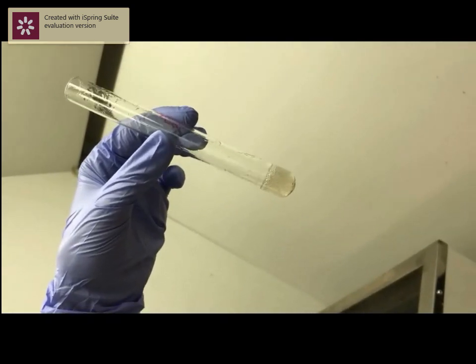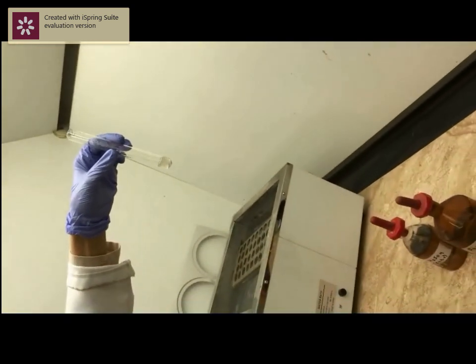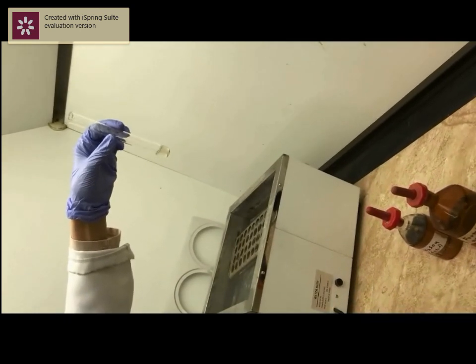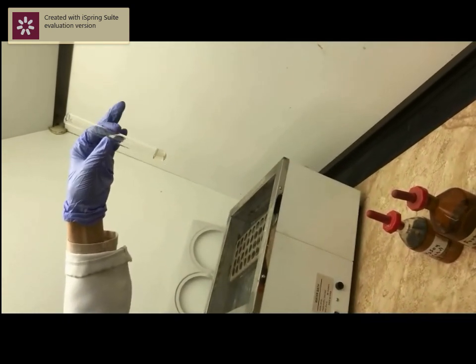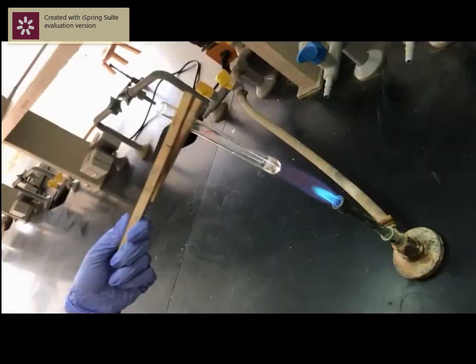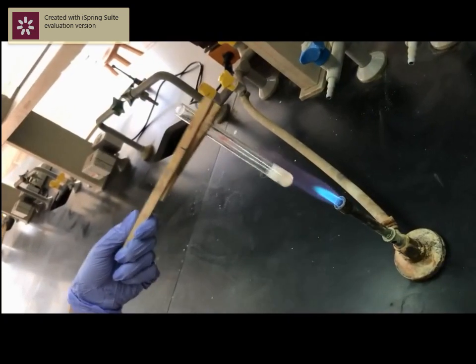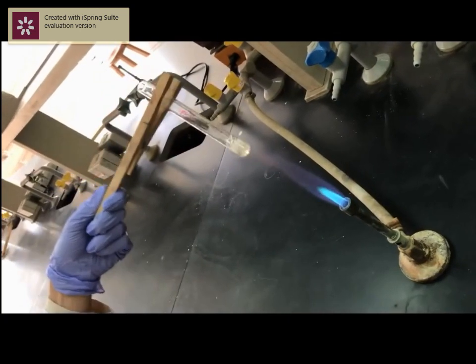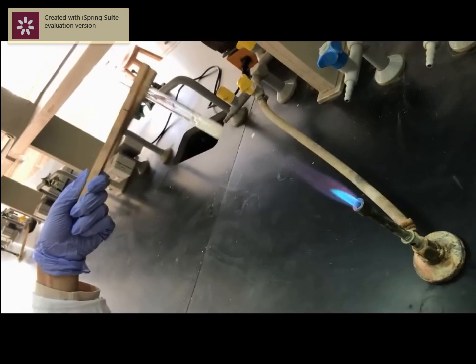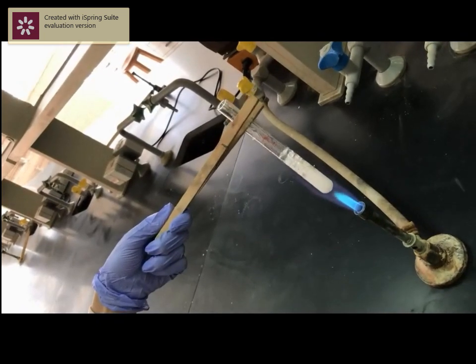Now we will identify the carbon monoxide by igniting the gas evolved and observing the flame. We will identify the carbon monoxide gas.